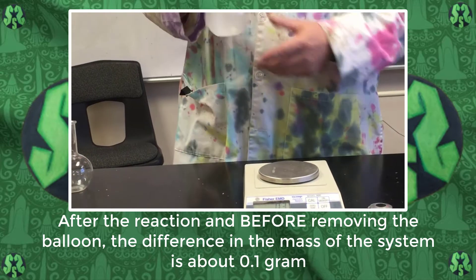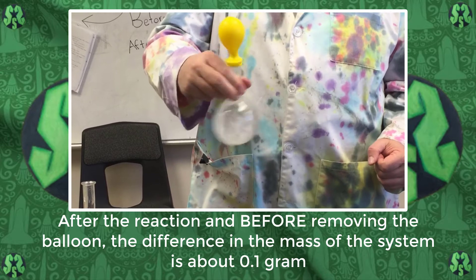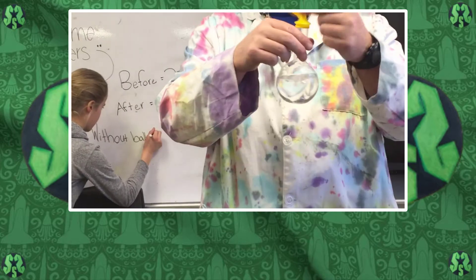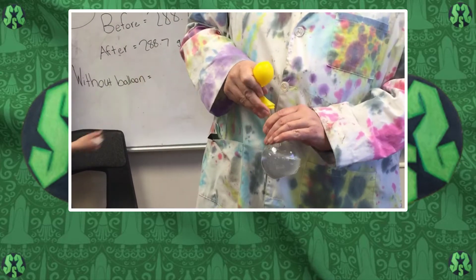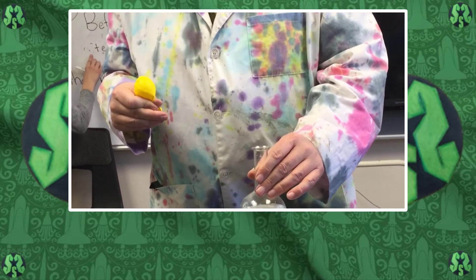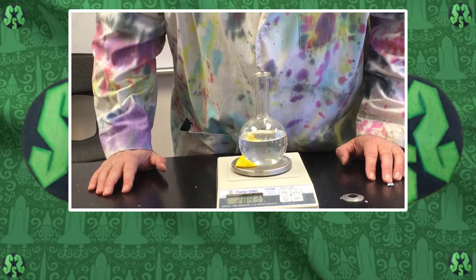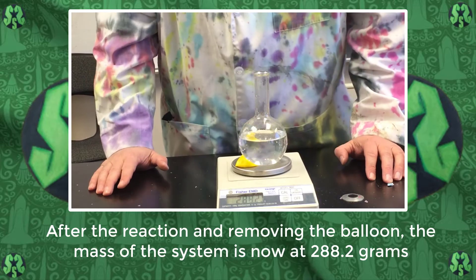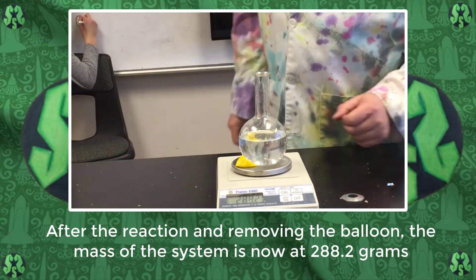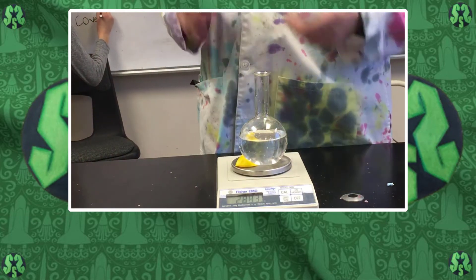Let me see if I can get this balloon off better. It worked a lot better when we weren't filming this. Okay, now I've taken this off and it now reads 288.2 or 288.3 - it's flickering back and forth. We'll just let this sit for a little while and come back to it in a minute.